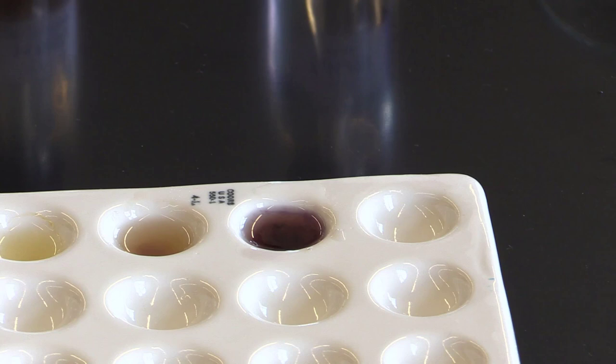This shows why we should never take expired medications, because the compound that we think we are ingesting into our systems may actually be something completely different. Thank you for joining me during our synthesis of aspirin today.